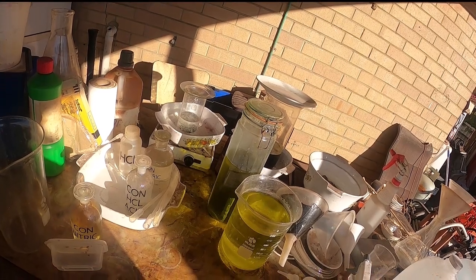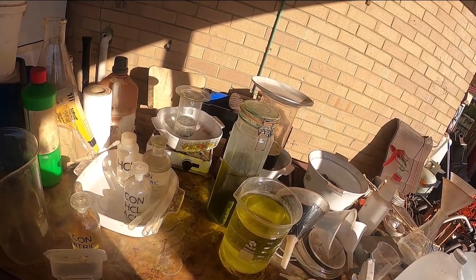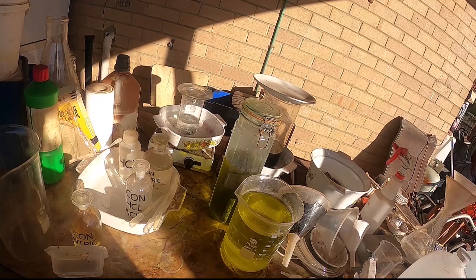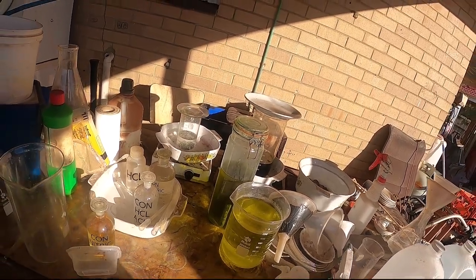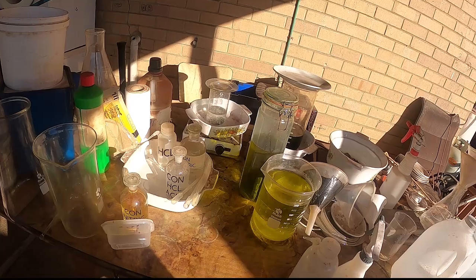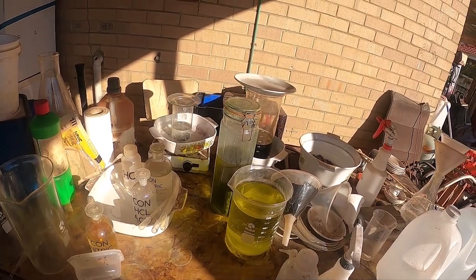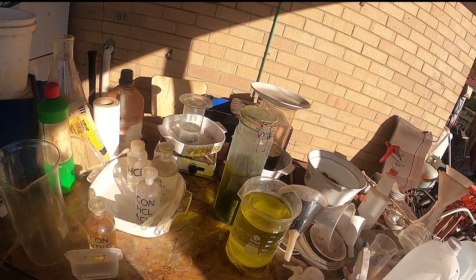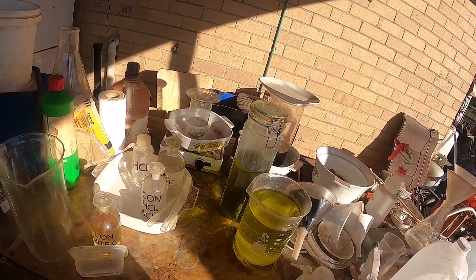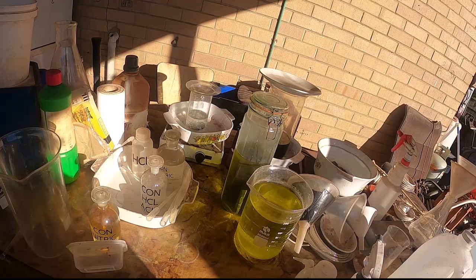Most of that will dissolve, and what you'll be left with is some black sediment — I just call it black stuff or black leftover. It's actually metastannic acid. You filter it off and that's it — it's as simple as that. Once it's dissolved, I'll put a filter in a beaker and filter off the solution, catching all the metastannic acid and any solder that hasn't fully dissolved. Once it's not fizzing anymore, it'll be good enough to filter.